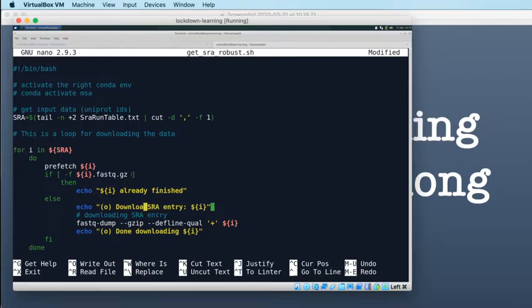Otherwise, we want to convert the SRA entry, and we want to do FastQ dump. So we want to do exactly the same thing, but instead of just putting the accession here, we want to put the SRA file that we want to convert. So that's the thing that goes at the end of the FastQ dump. So that's $i.sra. So that's the SRA file that we want to convert. And that will produce the FastQ from the downloaded SRA file. So assuming Prefetch runs fine, then our FastQ files will get generated.